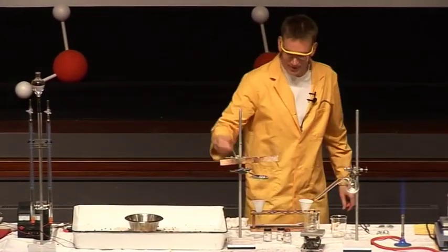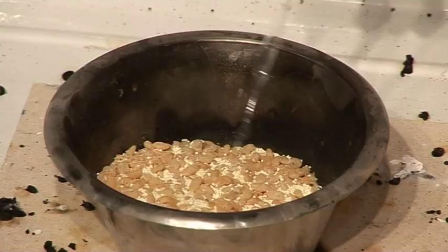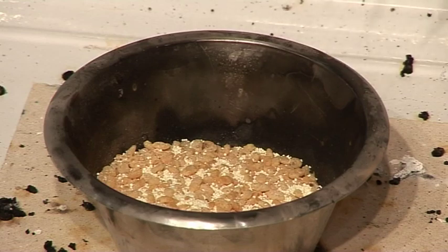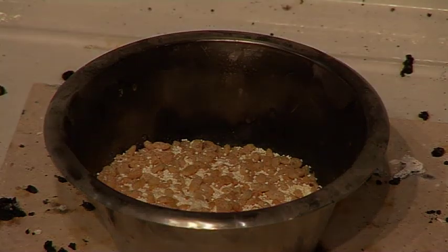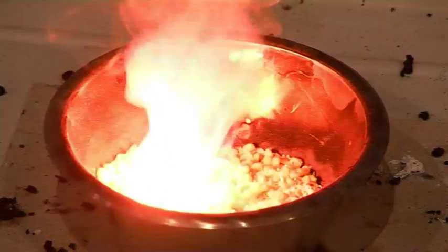So, drop in pipette. Add a little bit of water, in the same way you would add your milk in the morning. Maybe you'd add a bit more, but anyway. We'll come round. So, Rice Krispies, peroxide... and there we are.